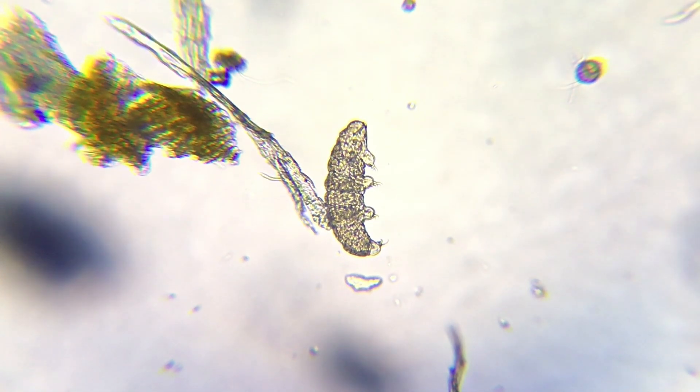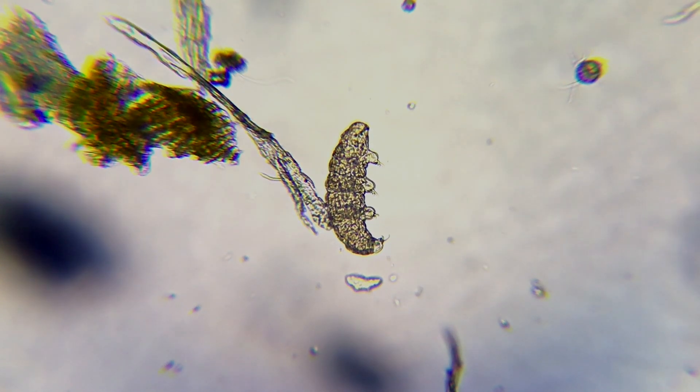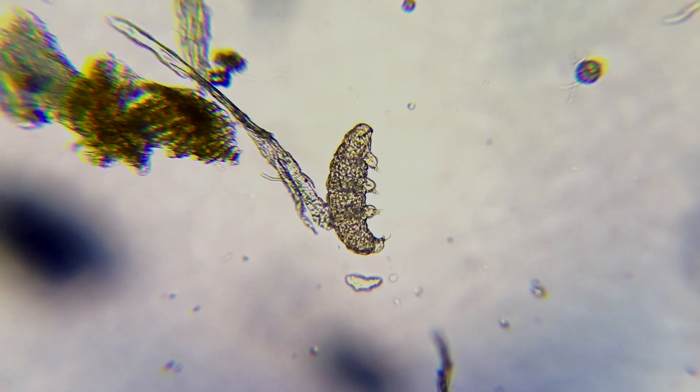And it's ready for going under the microscope and you'll be able to find some cool tardigrade footage — just tardigrades. There are lots and lots of tardigrades. Here's our first ever tardigrade. We just filtered it — it was in a huge thing of water for a couple of days. After using this method, we usually find about three tardigrades per slide. I do recommend making that tardigrade water. Make sure it's a very thin layer, so that it's not too thick and they won't be slowed down.